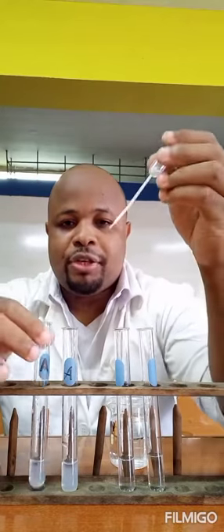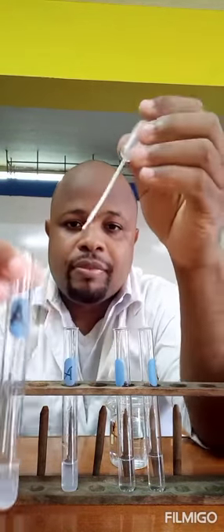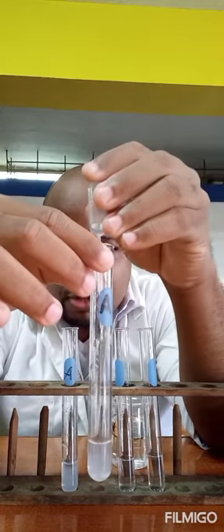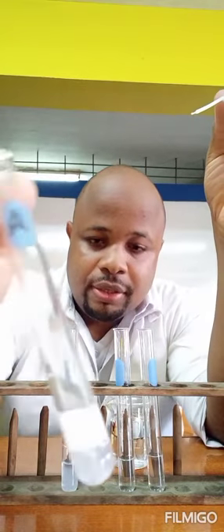As per usual, we're going to start with sodium hydroxide. I'm going to add a few drops. It's a colorless solution, so we know it couldn't be copper(II) — that would have been blue. It couldn't have been iron(II) — that would have been green. And if it was iron(III), rusty brown or red-brown. So let's add a few drops of sodium hydroxide, and we see we get a white precipitate.